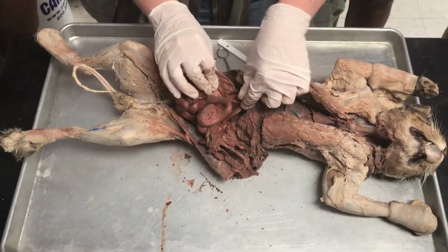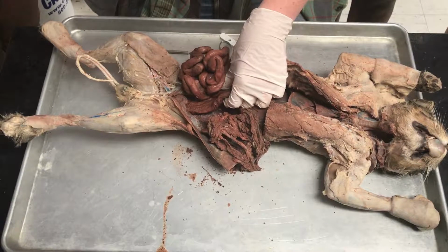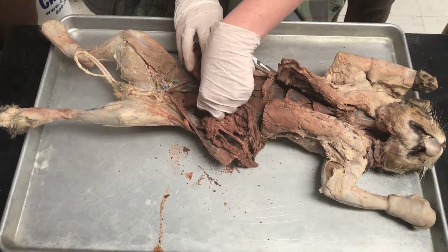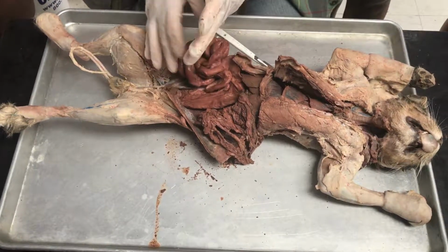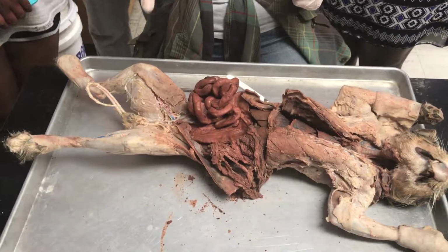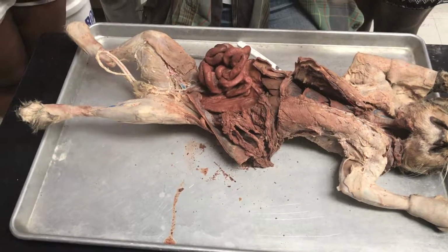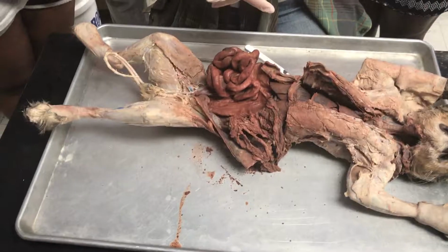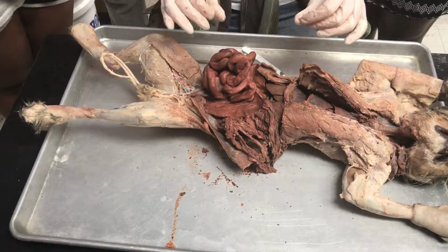Now the large intestine is the same thing as the colon. So humans have an ascending, a transverse, and a descending colon. So large intestine and colon, synonymous. The colon is going to lead into the rectum and then to the anus where feces is going to come out. So within the anus, you have two sphincters. You have an internal sphincter that is involuntary, and then you have an external sphincter, which is under voluntary control. So that's the tube itself.